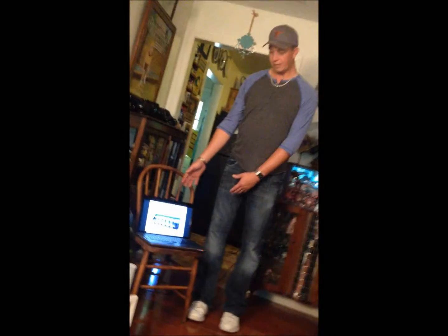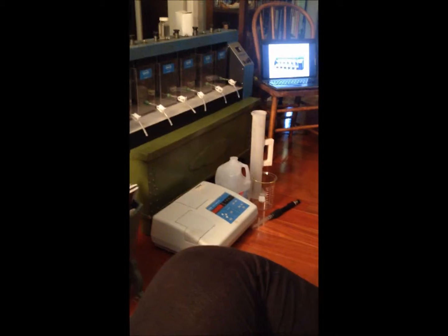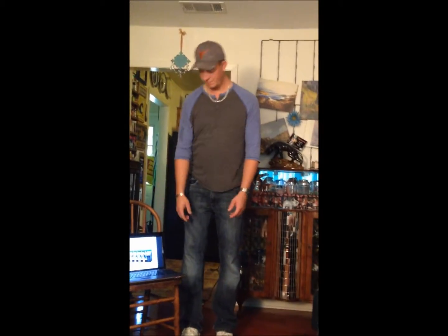This is my PowerPoint presentation here, my jar tester, my turbidimeter, and all the supplies. I'm not actually going to run a jar test because there's too much involved in it and it's going to take too much time.